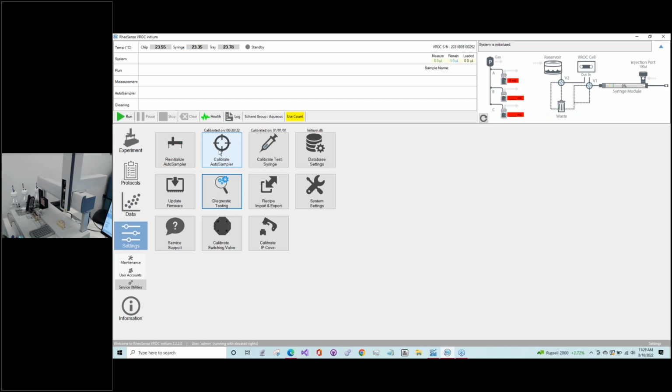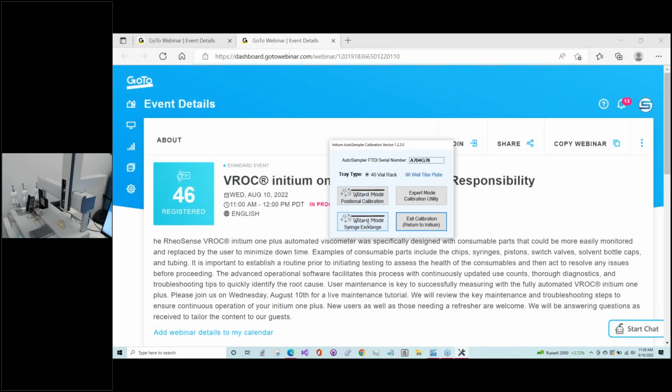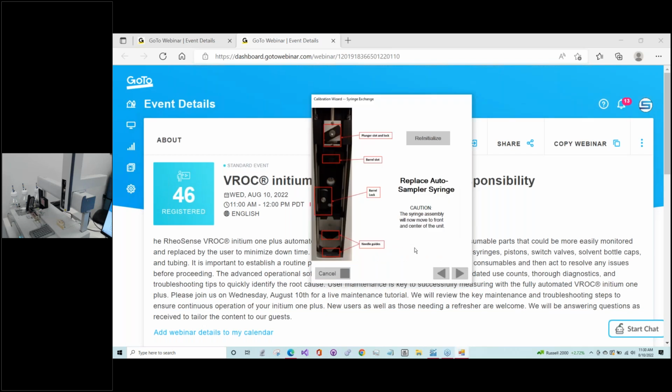And so the way you would do this in terms of swapping it out, the easiest way is to go back to your settings tab and the service utilities and go to calibrate auto sampler. So we're not going to calibrate the auto sampler, but what we're going to do is select wizard mode, syringe exchange. This basically steps you through what you need to do to take this syringe in and out. And it will also move the auto sampler forward to a convenient position for you to do that.